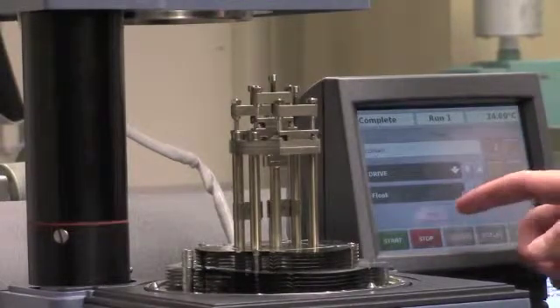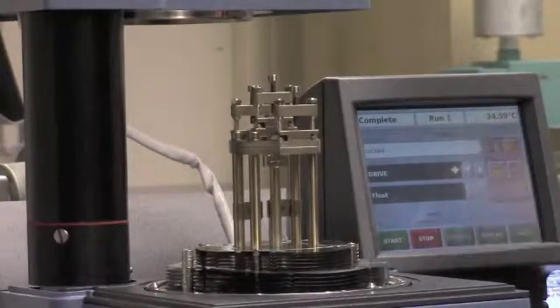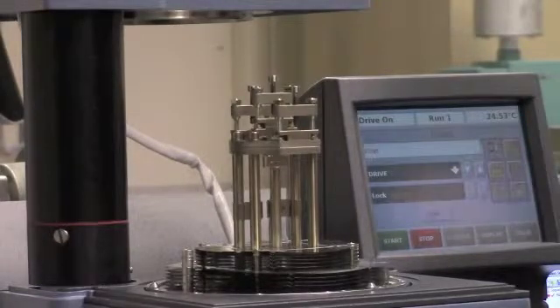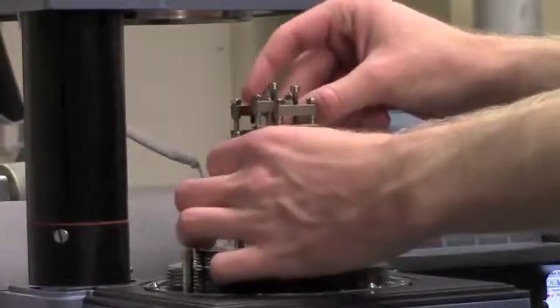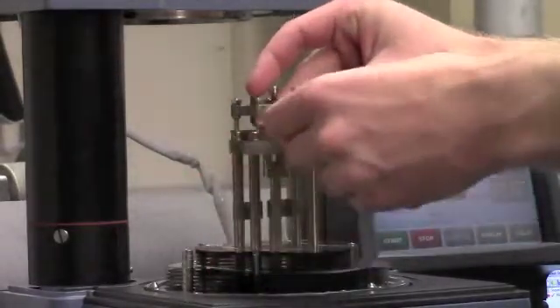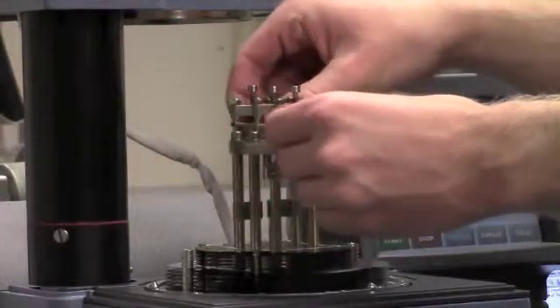Next, set the air bearing to float. This allows the center jaws of the clamp to move up and down. Then, insert the sample between the jaws of the clamp. Following this step, the screws on the clamp's jaws can be finger tightened.